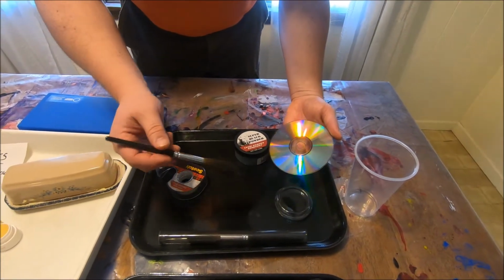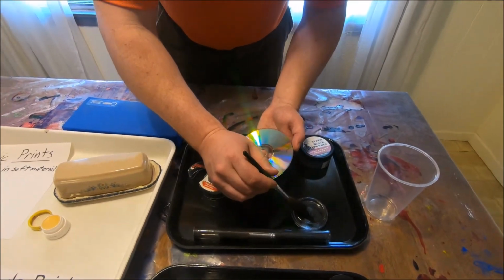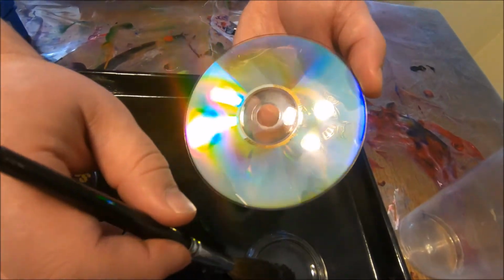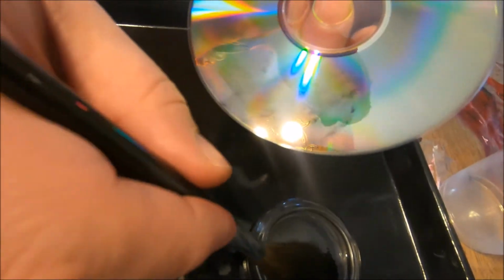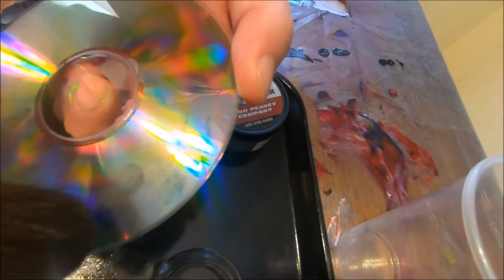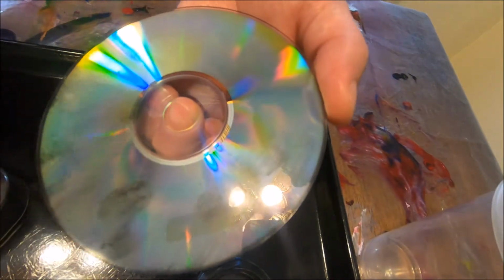Too much dust can leave us with a print that's not going to be able to be used. So we want to focus in on a little bit of the powder and then just lightly brush on areas and hope as we're going to have a print start to appear on the page. Now as we start to get those prints to appear, we can add a little bit more dust to them to get those to become visible. Now the key is not to over dust.